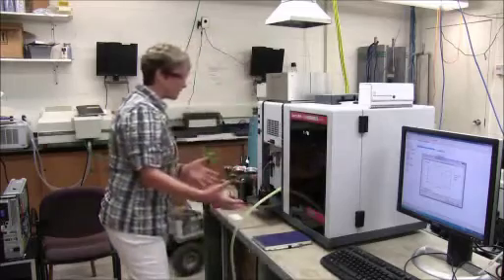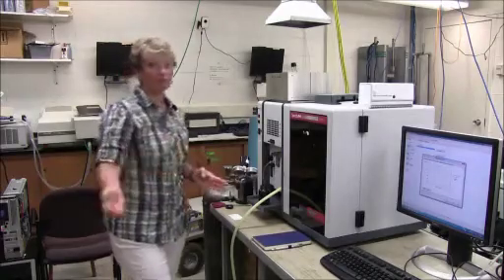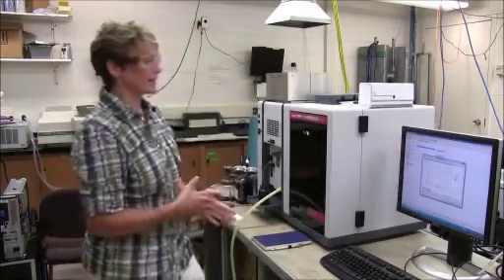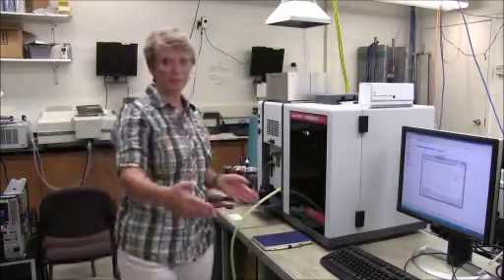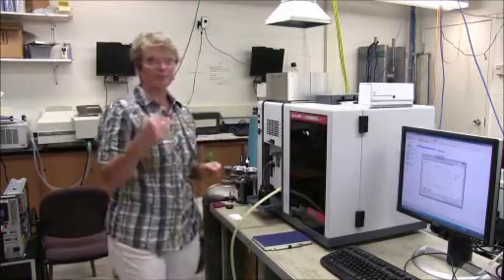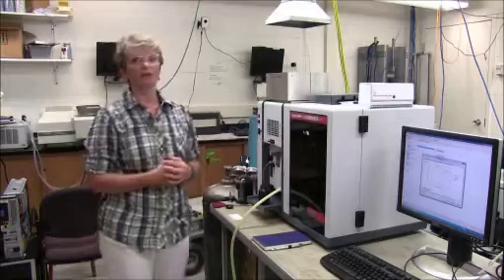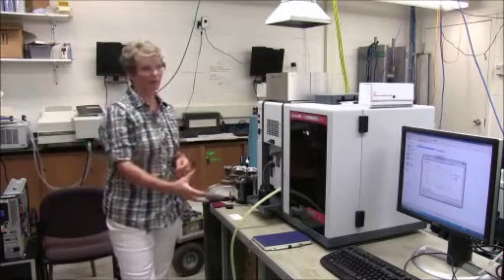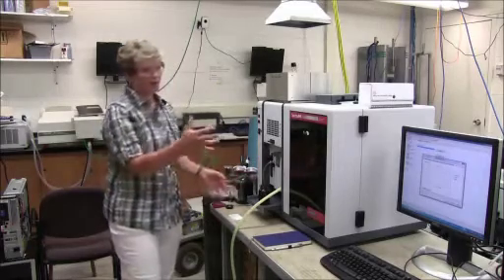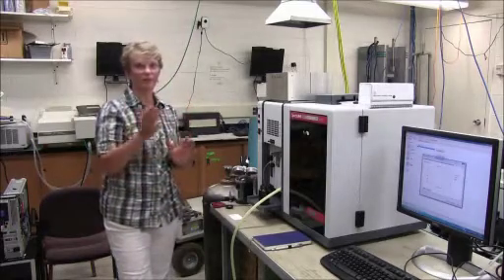So when you're introducing your standards then, if your absorbances are increasing, or if they're doubling, say you had 5 milligrams per liter, and the next one is 10, and then 15, and then 20, and then 25, you want to see subsequent increases in absorbance that are matching that. And if you have software such as we do that will graph it as you're going along, you'll be able to see right away if you've screwed up on one of your standards, or you need to redo it again because maybe it started reading it before you were aspirating it.